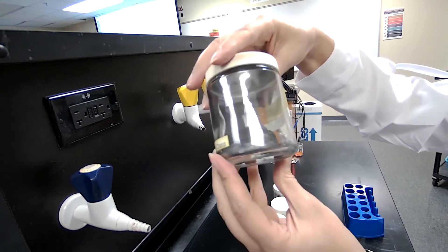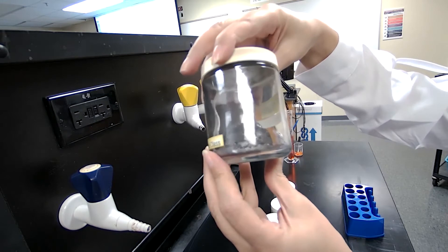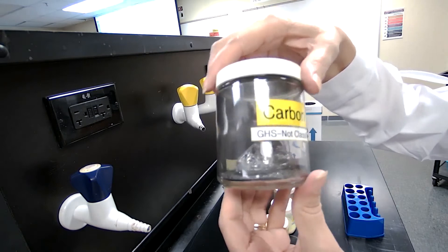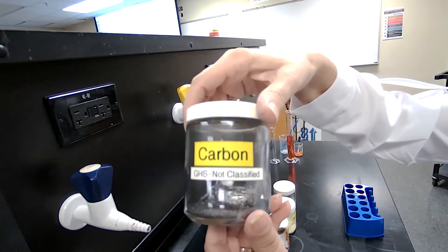You can pause the video at any time you like to focus on one element and record your observation for these elements. So we are looking at the element of carbon.